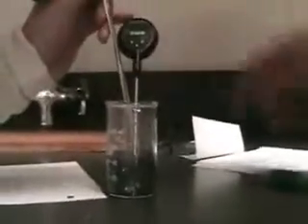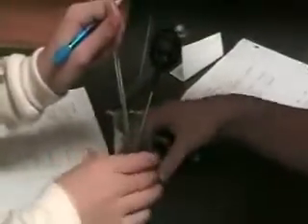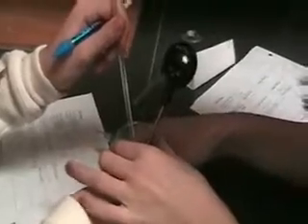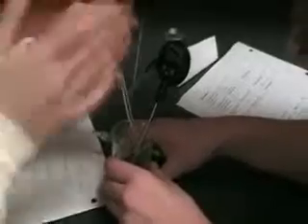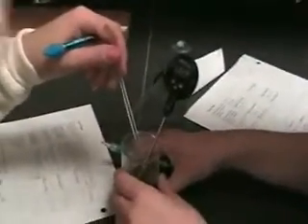What's happening to the temperature? The foil's going up — it's rising extremely. And it's warm, like a hand warmer. It's 40 degrees. It smells weird. Maybe that's what they put in hand warmers — the kind that you break and they get warm?